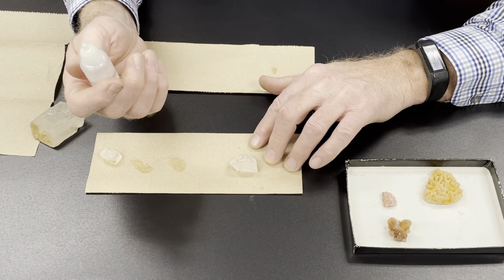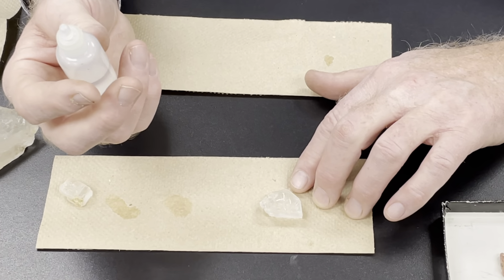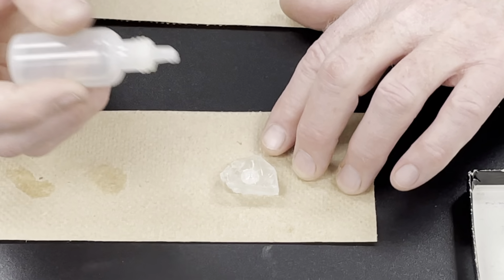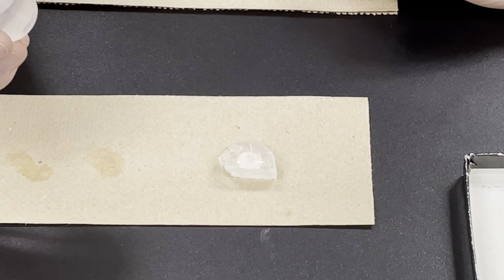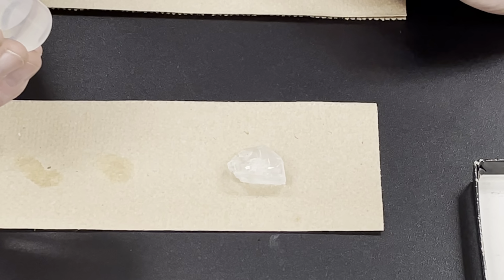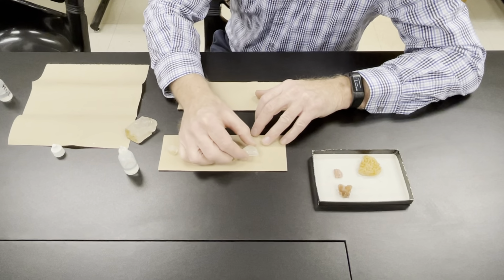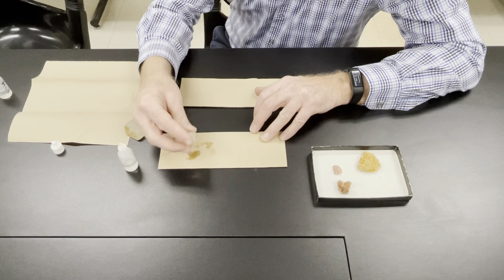But what we're going to do, I'm going to put a couple of drops of acid on this, and then Mara's going to zoom in, and you're going to see bubbles in the drop of acid. So are you ready? Mm-hmm. Here we go. So I can see the bubbles forming. It's fizzing pretty well. There's a big bubble in the center. Ooh, just burst. But that is pretty vigorous effervescence of calcite. So I'm going to go ahead and wipe this one off.